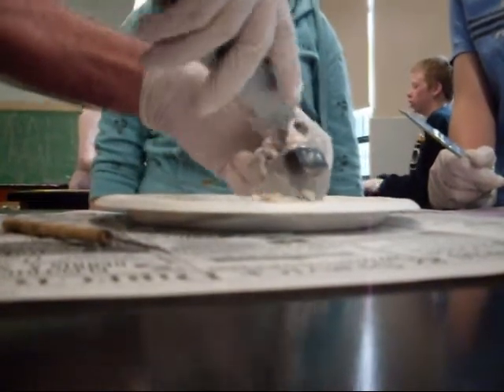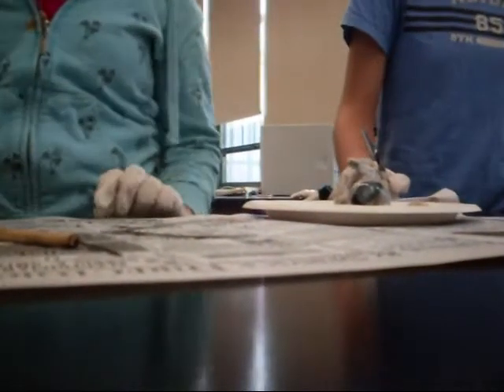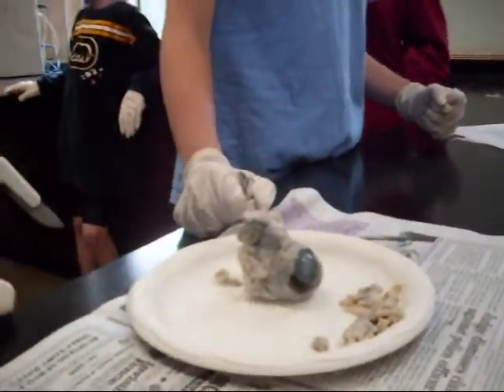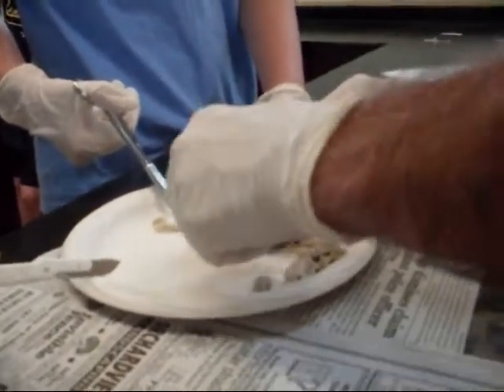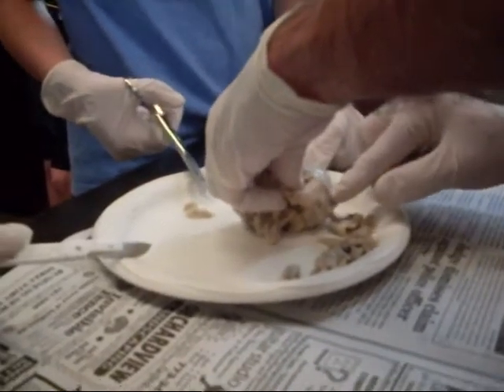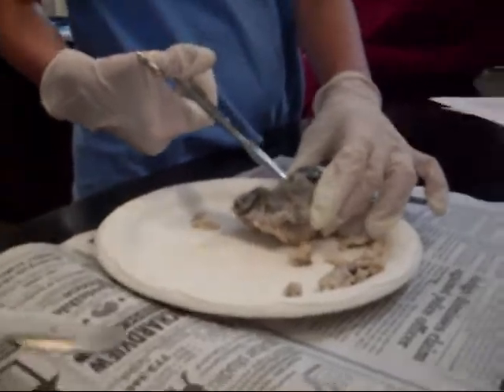Whoa. That's hard. So the scissors just continue cutting around, so you've got like the front half and the back half there. Alright? Keep cutting this white stuff? No, you don't. Just cut it around. So you're going to cut all the way around, so it's going to be the front half of the eye and the back half. Just put the scissors there and just cut all the way around. It doesn't work. This gentleman has to go on YouTube. No, that's much more. Just kidding.